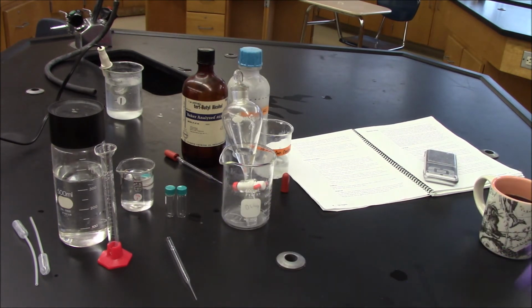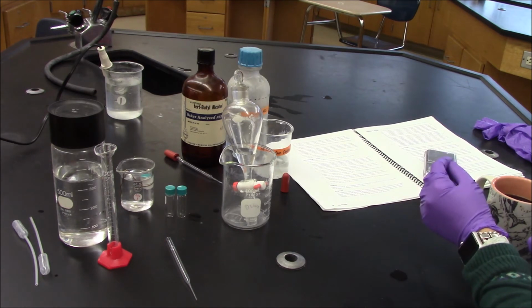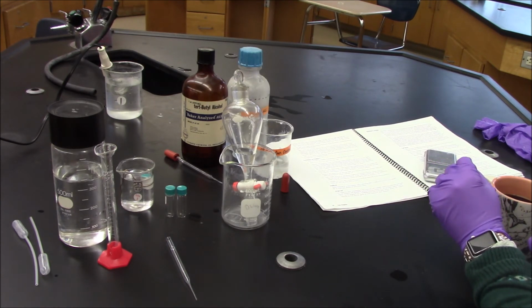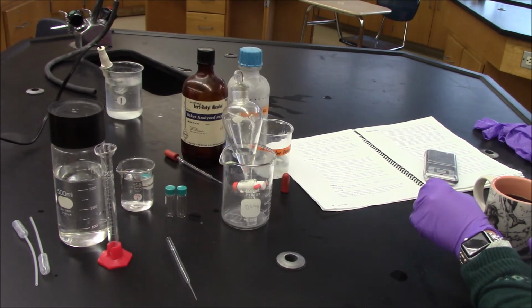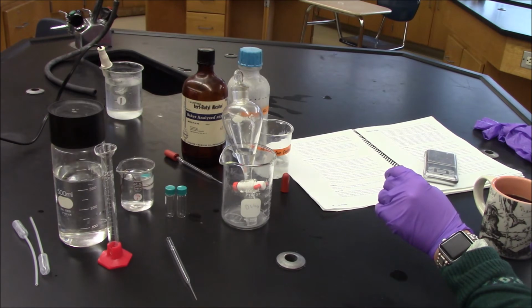I'm going to wait for the 3 minutes to pass. And when the 3 minutes passes, I'm going to carefully observe what's in my reaction vial and note that there are 2 layers. The lower layer is the aqueous layer. It contains anything that's unreacted, so that could be hydrochloric acid and t-butyl alcohol. The upper layer, supposedly, contains my product, t-butyl chloride. I'm going to use my Pasteur pipette, and I will carefully remove the upper layer from the reaction vial. And slowly, I will add this upper layer to my sep funnel containing the ice water.